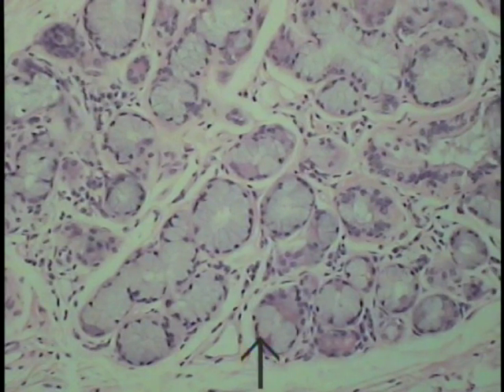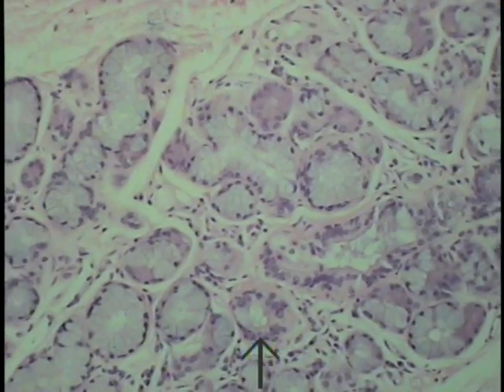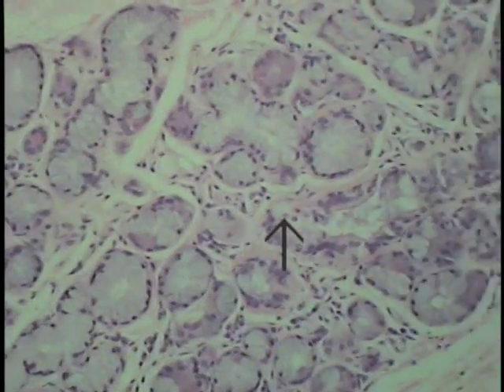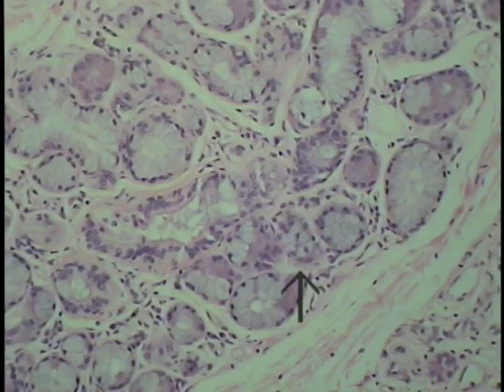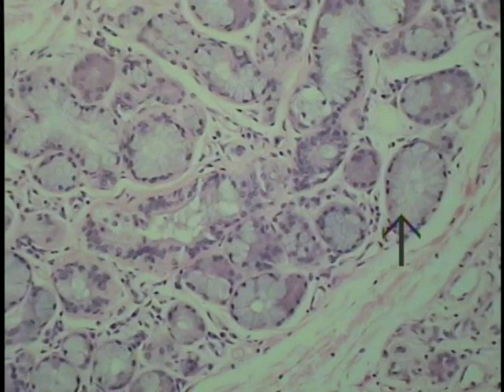Increased magnification of one of the tracheal glands. Remember, these are compound tubular alveolar glands, as was stated earlier. One can see sections through portions of the mucus tubules, as well as scattered elements of these light granular serous appearing cells. In this particular case, they're forming demilune type structures. Here, once again, if we look carefully, you can see a mucus tubule and its association with a serous element here, and the same thing is true of this particular unit shown at the top of the field.